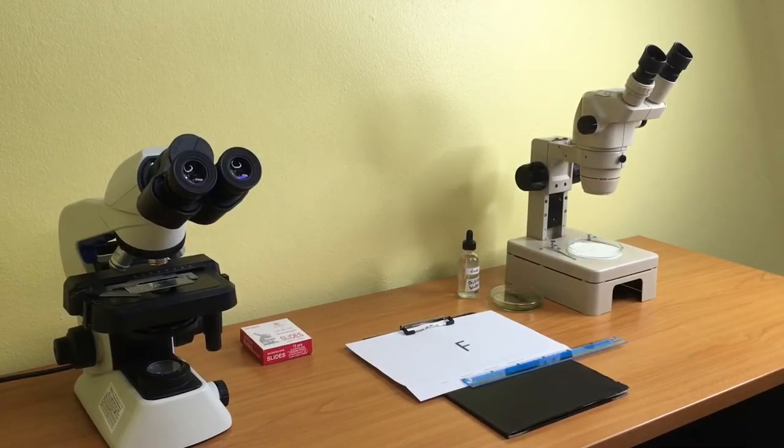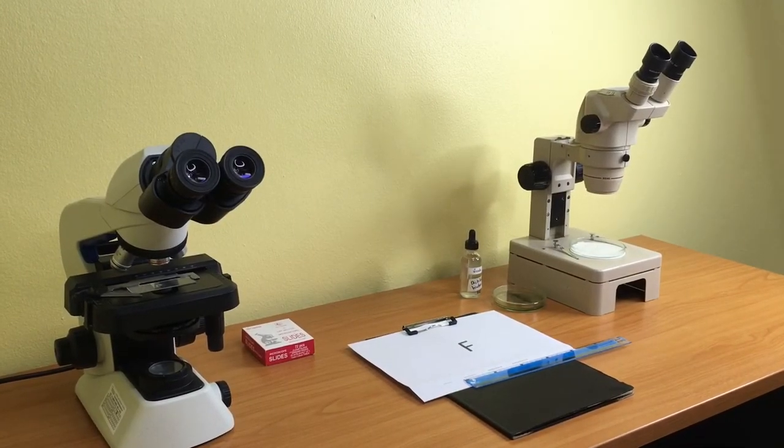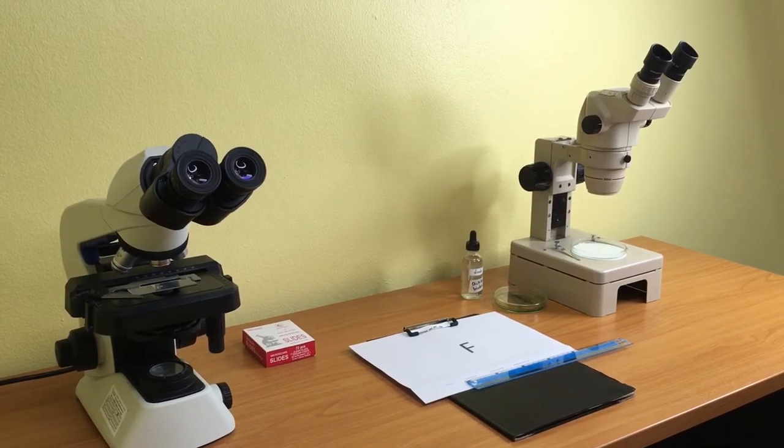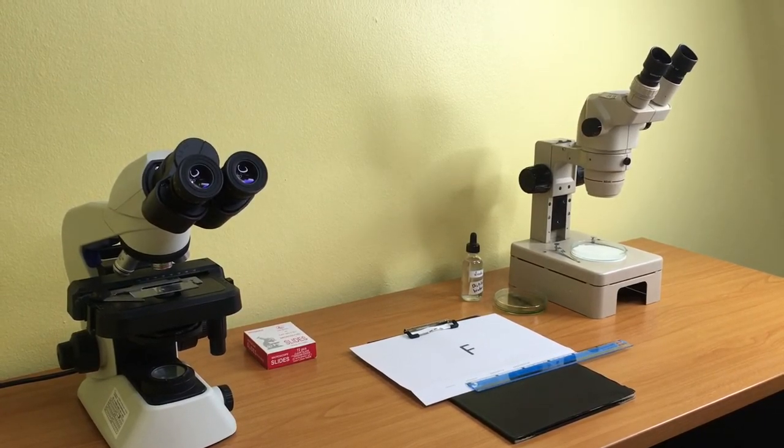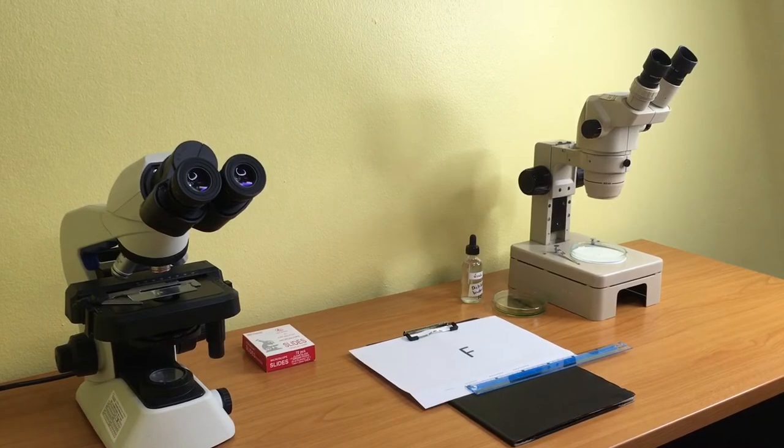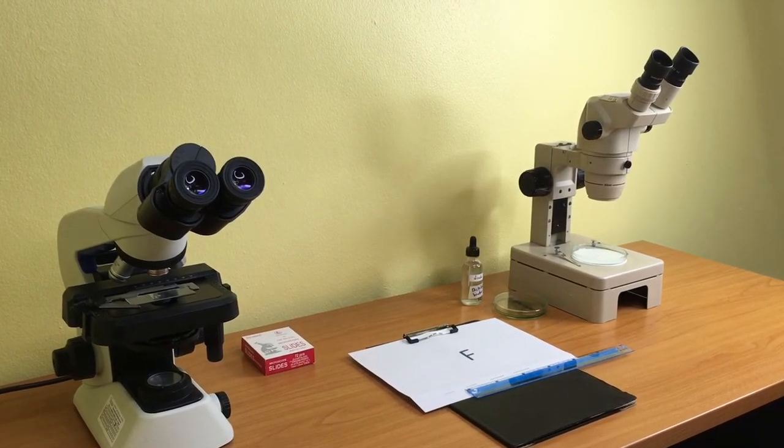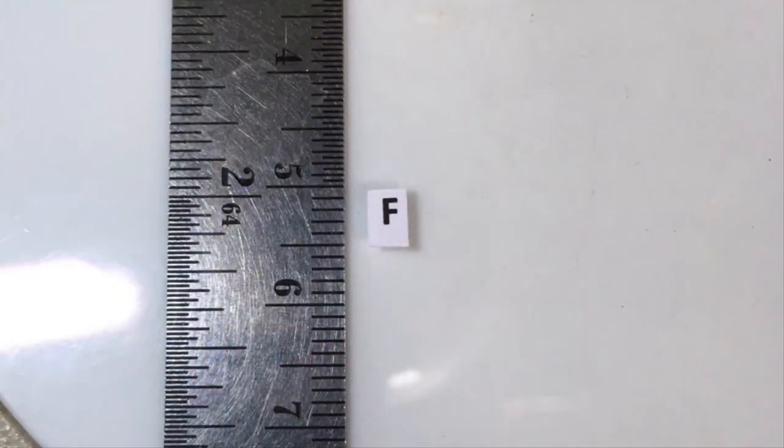Next, you will compare the differences of images viewed through the transmitted compound microscope with stereo microscope. First, draw a letter F.